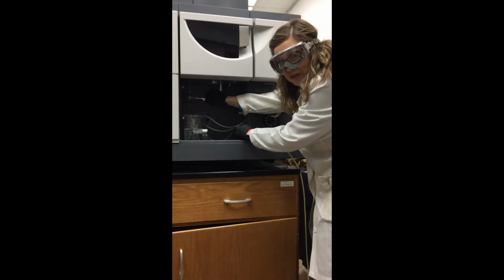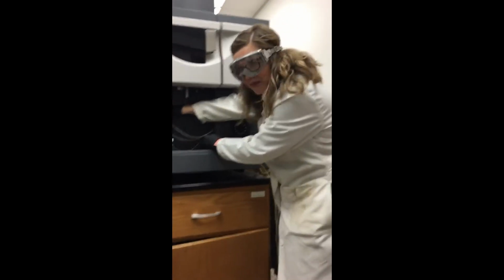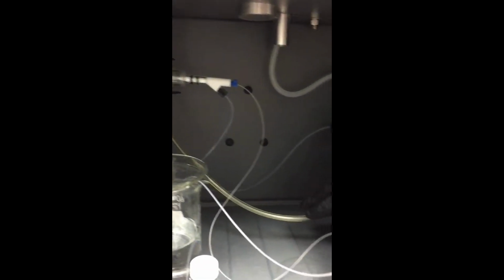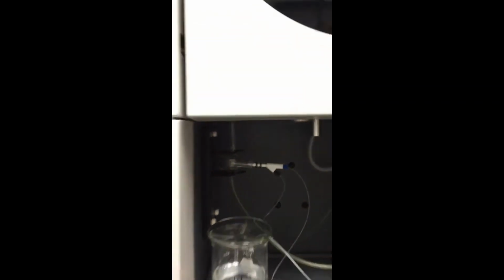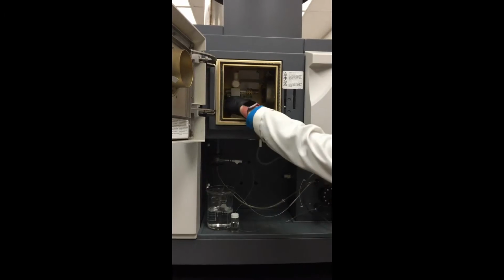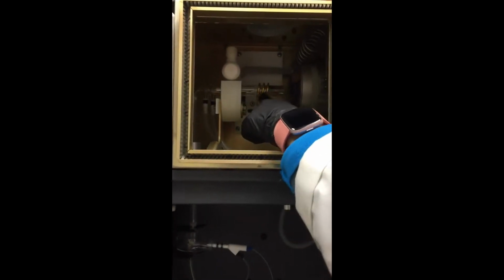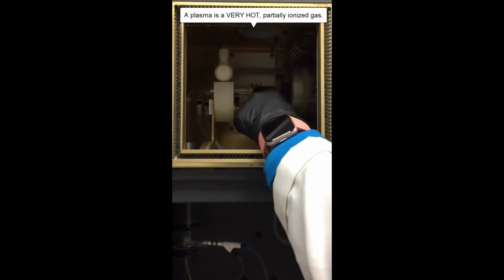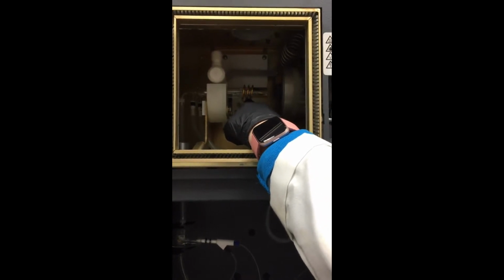into the nebulizer. This is where the aqueous sample is converted into a mist, and a lot of that sample does go down the drain into a waste beaker, but some of it does go through this transfer tubing, and that mist continues through this tubing, and then it goes to the torch. When we light the plasma, you'll be able to actually see the plasma where your sample gets atomized and electronically excited.